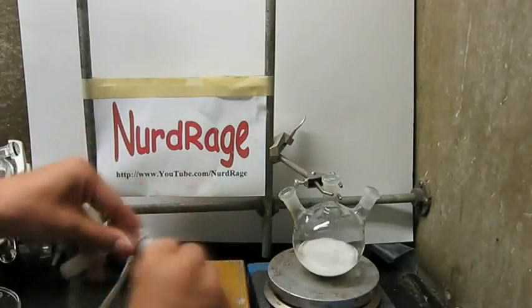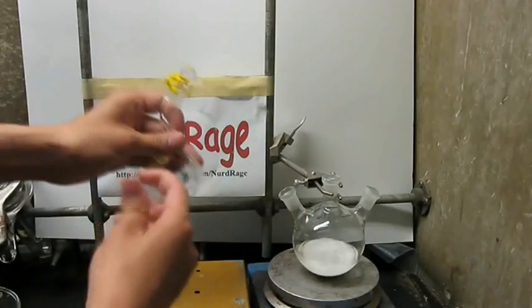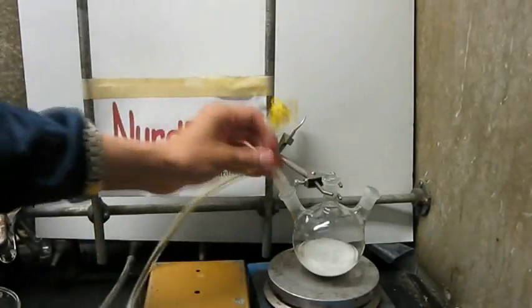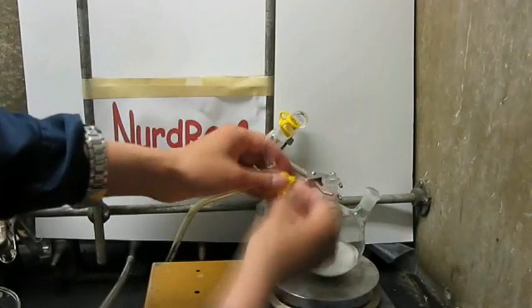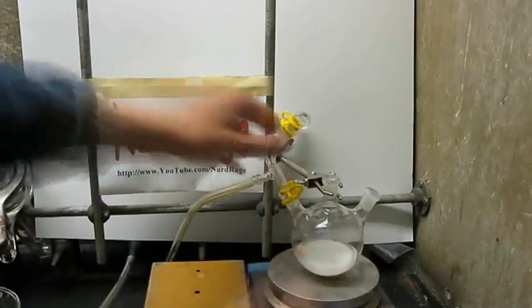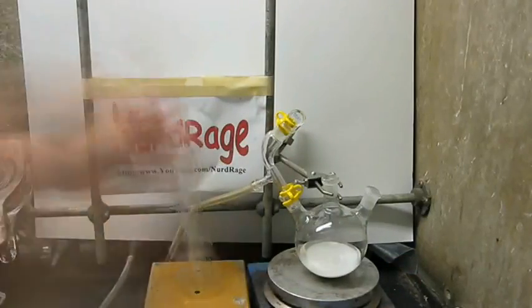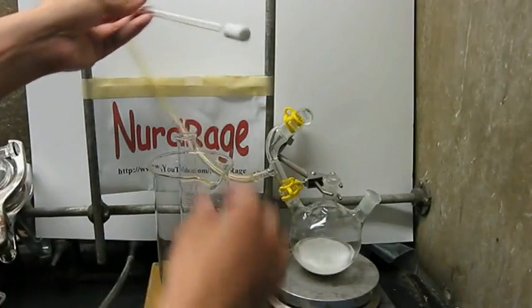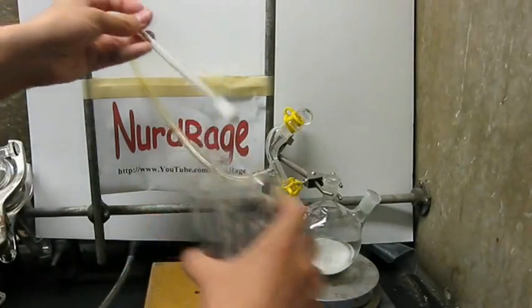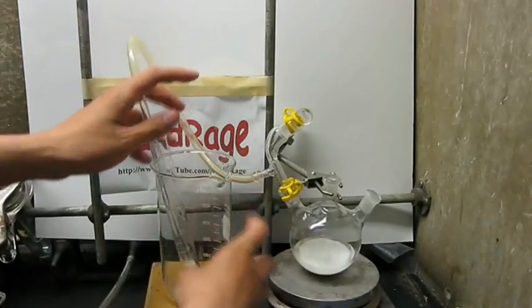On one side, hook up a gas adapter and outlet tube. I'm using a stopper distillation adapter because I couldn't find my actual gas adapter. Obviously, when you do yours, use a proper gas adapter. Now get a 25 milliliter graduated cylinder and a beaker that will fit it. Our gas outlet tube has a gas dispersion tube end, but you can use a straight tube if needed. Okay, lead the tube into the cylinder.